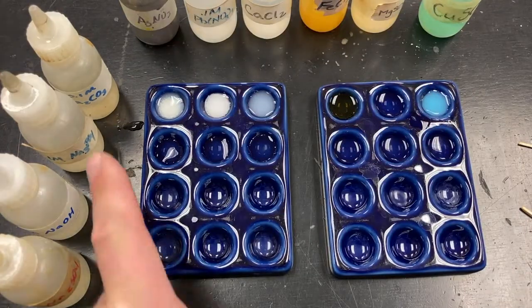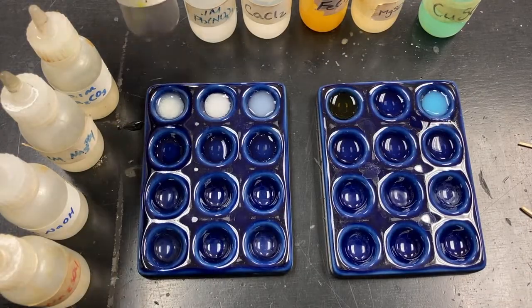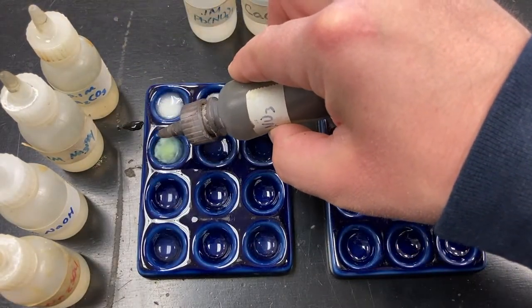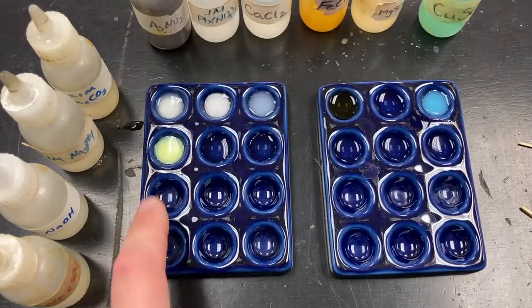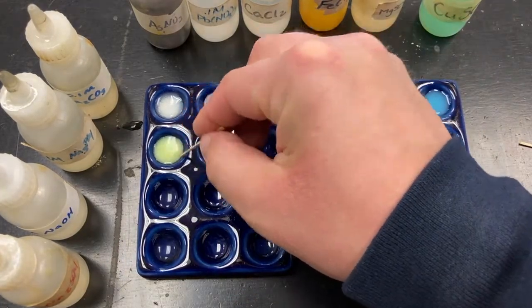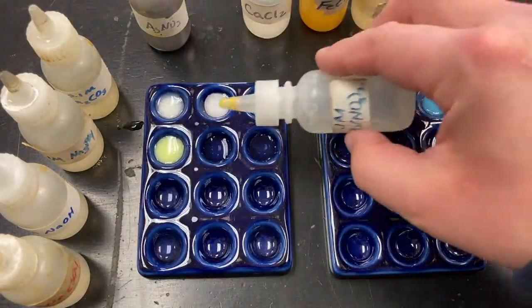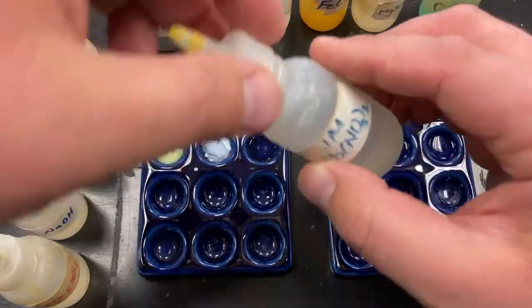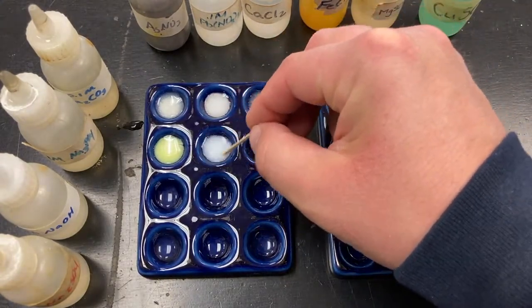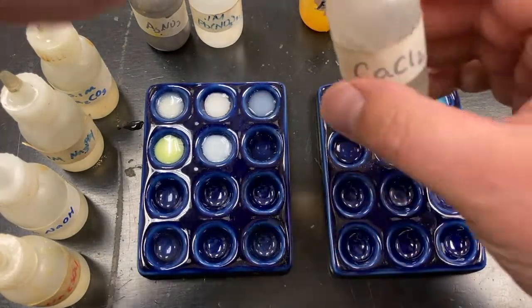And we're going to see if phosphates like to create precipitates. So let's do the same 6 chemicals with that solution. So here's silver nitrate. It's a yellow solid, yellow specks. Lead nitrate. That's a white solid. It's actually more milky, right? So it's like a white, swirly, milky substance.